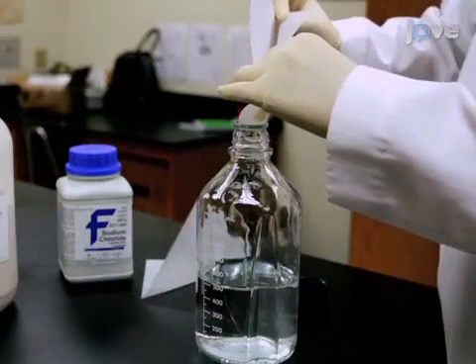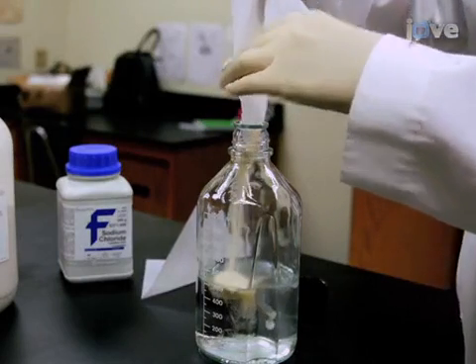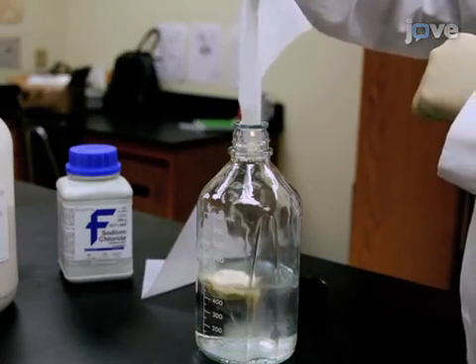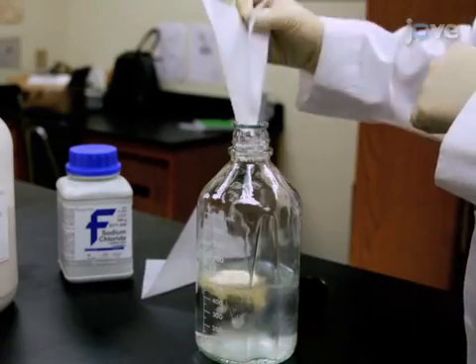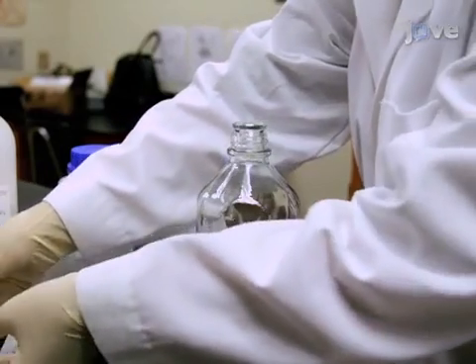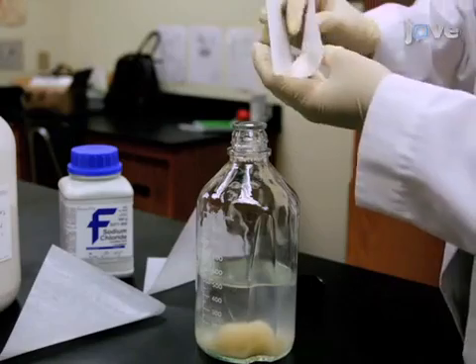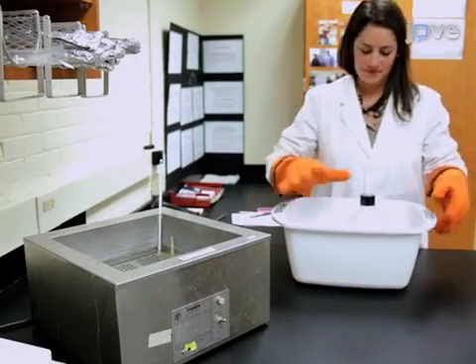To prepare agar for 50 plates, first add 1.5 grams of sodium chloride, 8.5 grams of ultra-pure agar, and 1.25 grams of peptone to 487.5 milliliters of deionized water in a 1-liter flask or bottle. Gently swirl the contents to combine them. Sterilize the solution by autoclaving.